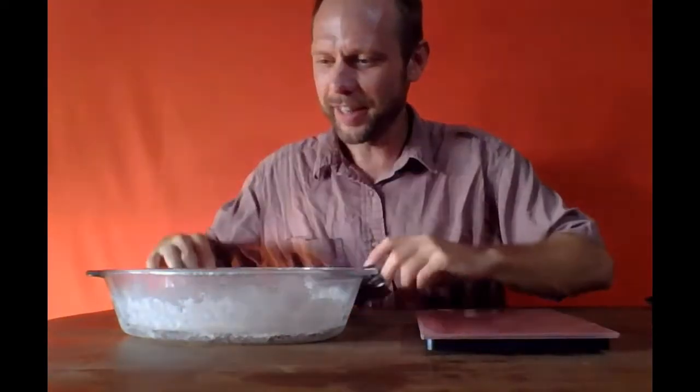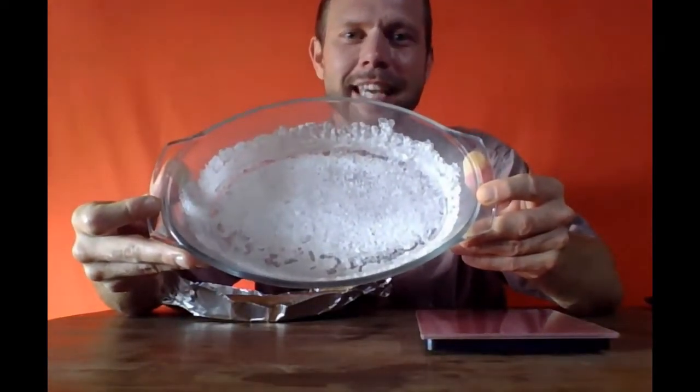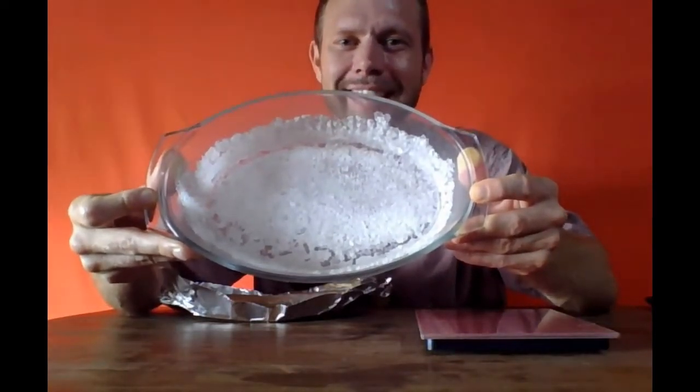And again, I have a feeling that it's done. We're going to give it another try to make sure we maintain a stable weight, but you can see that this is pretty dry crystal. And note the strategy of weighing this empty dish, weighing the dish with the salt in it, including the aluminum, because it is going to take a little bit of effort to scrape all that salt loose. If I wanted to scrape it loose and weigh it, we might end up losing a gram or so in the scraping process. So this method of weighing the dish before and after we crystallized is going to give us a better estimate of how much salt we really have.